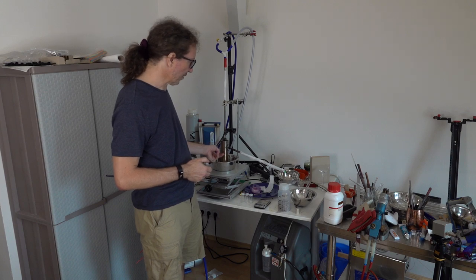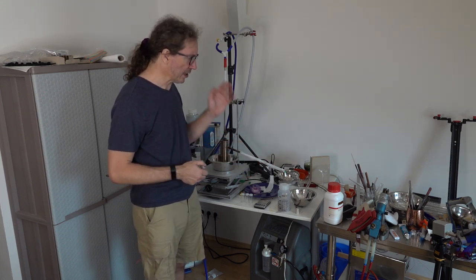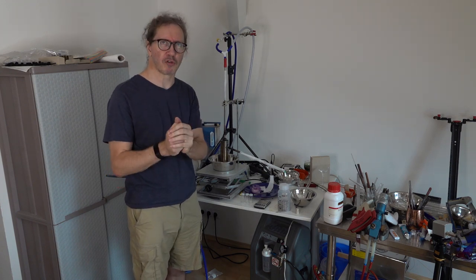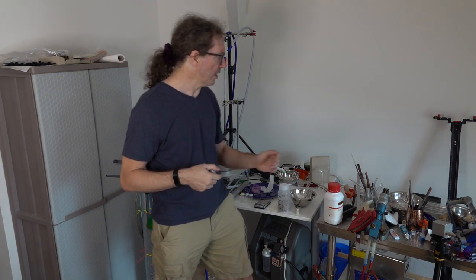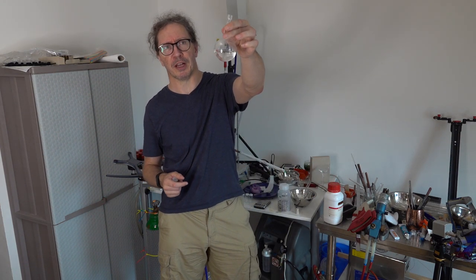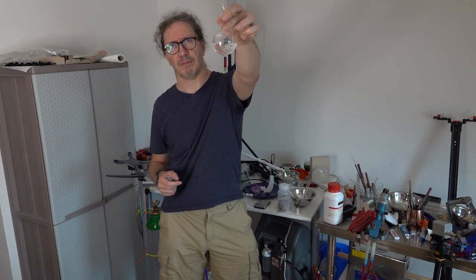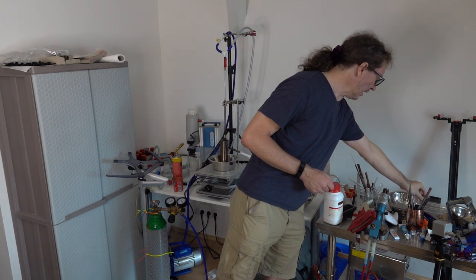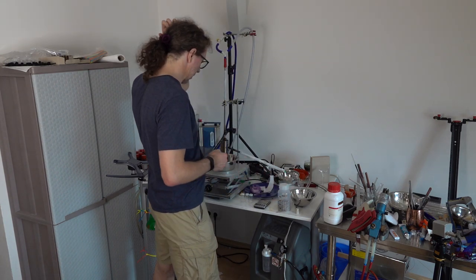So my reckoning is, I'm going to do 100 grams. The density of cesium is about 2 grams per mil, so that's going to be about 50 mils. It's about that much. That's how much cesium I'm going to be making. So what can go wrong?